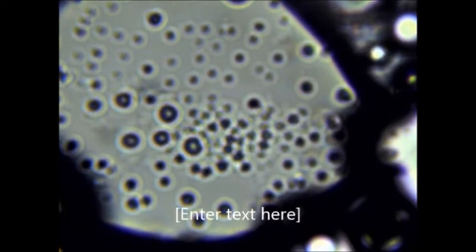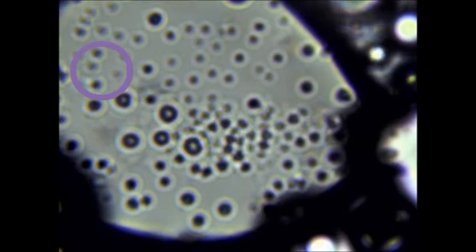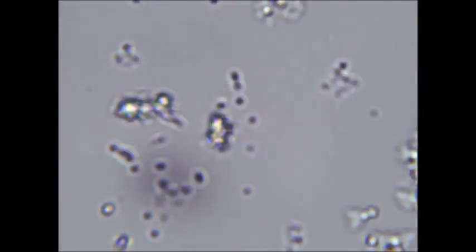As you can see, there are many much smaller vesicles inside of a larger one. Since the only two things in this solution are fatty acids and distilled water, aside from the Sudan 3 reagent, and fatty acids always show up as round spheres, we can conclude that the very small round spheres are very small fatty acid vesicles. Okay, so this next slide is a prepared slide of my experimental mixture.